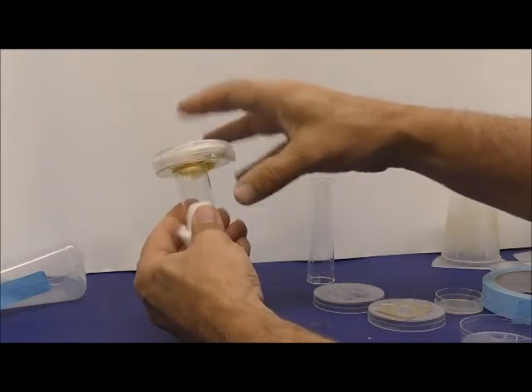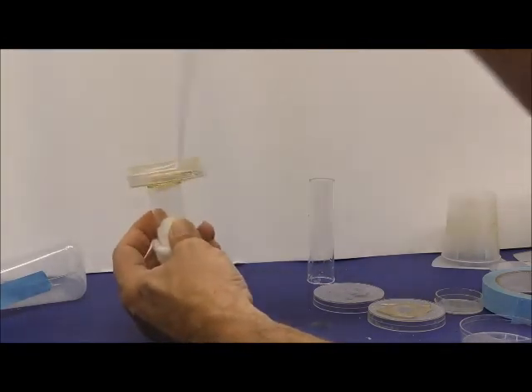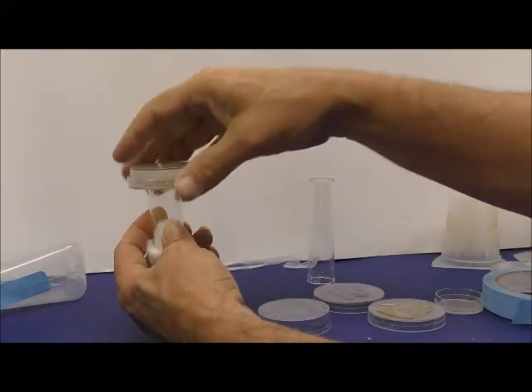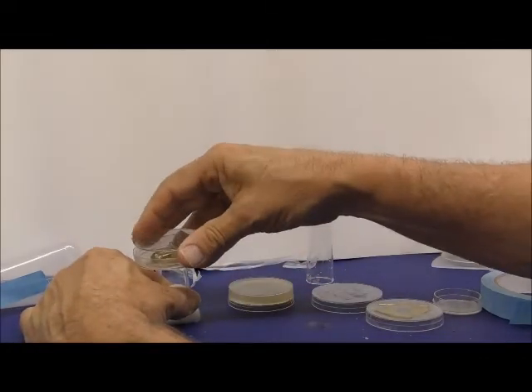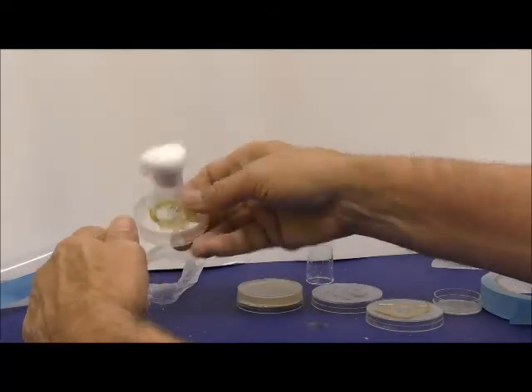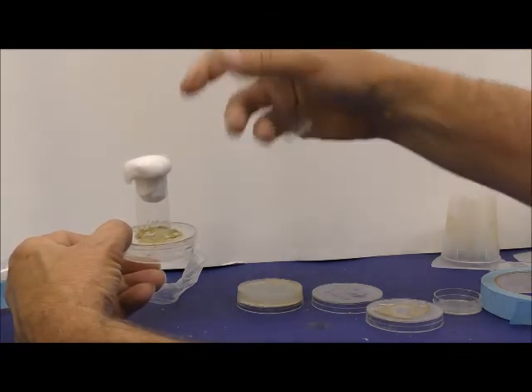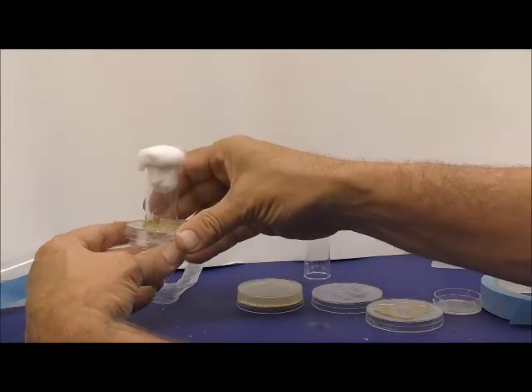You just have to shake the adults down so they'll be in here, have this ready to go, and have another container ready with the food. So you'll have one with agar and food ready. And then you shake them down like that, and you quickly switch it over to the other one, and then rewrap it around. And now you'll have everything easily contained in here. If you leave a longer container, it's easier to keep the flies away from the opening when you change it out.